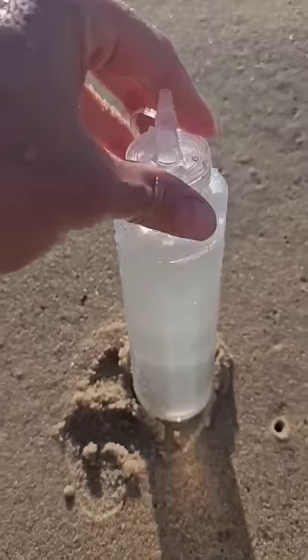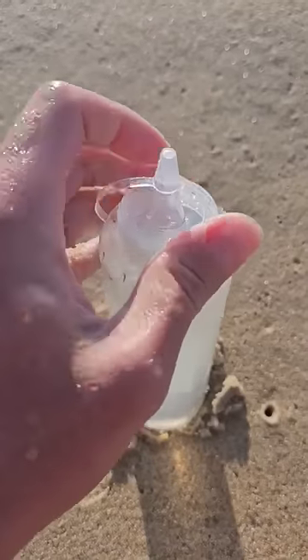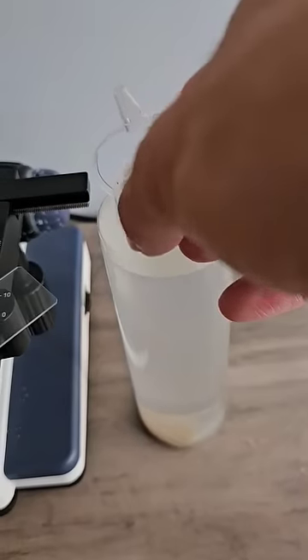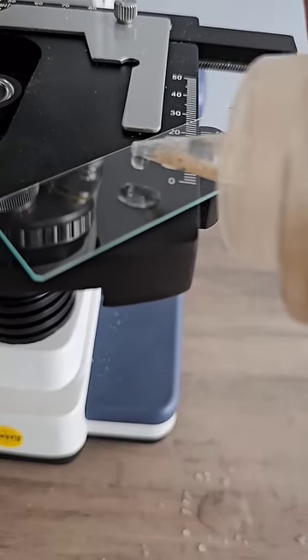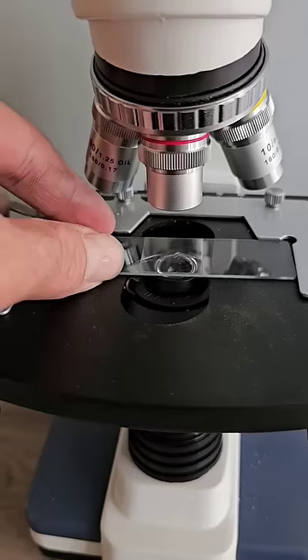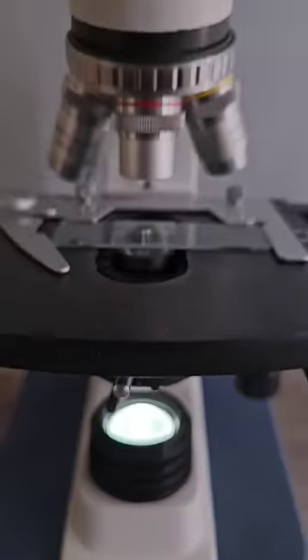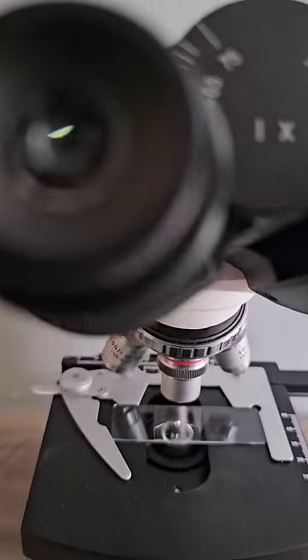Let's get a good sample of this water, then we'll take it back to the beach house and examine it. I'll add a few pieces of sand onto the slide just to see how small microbes are compared to grains of sand.